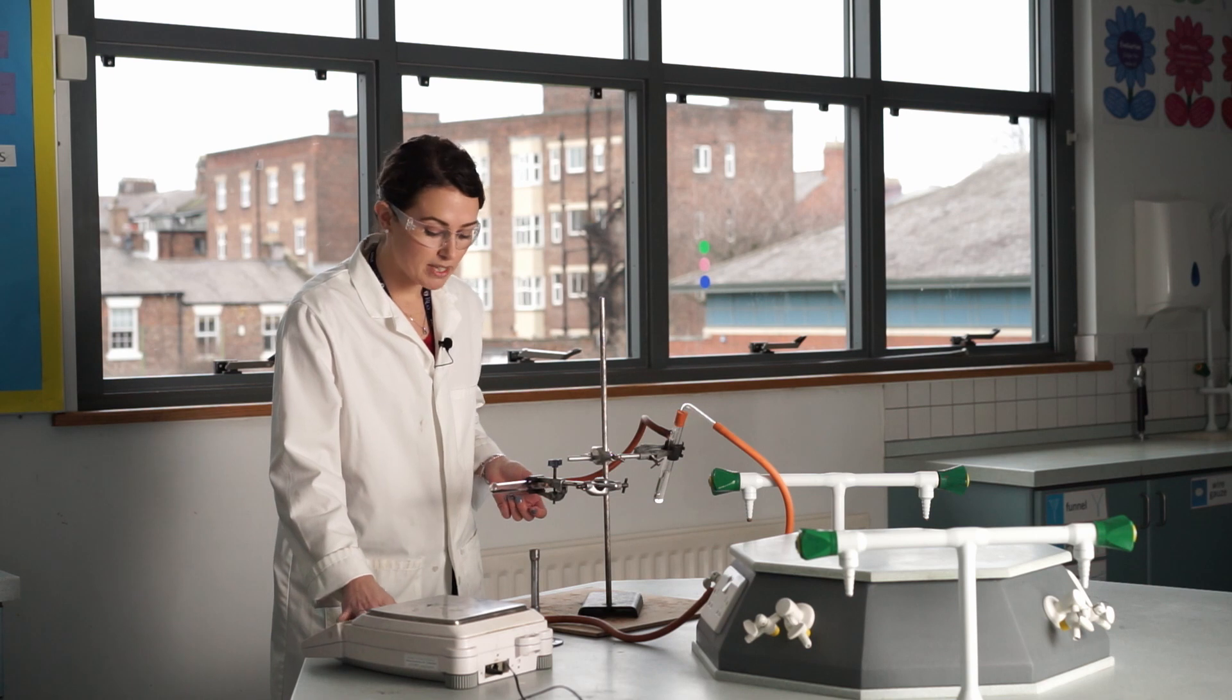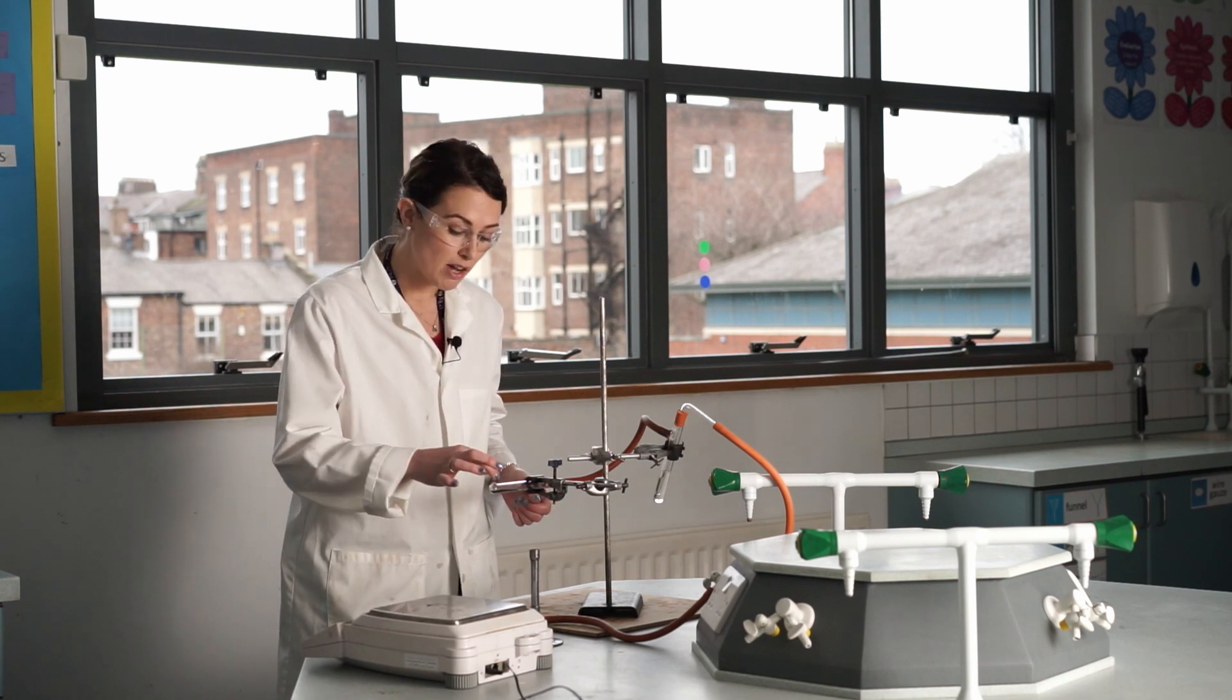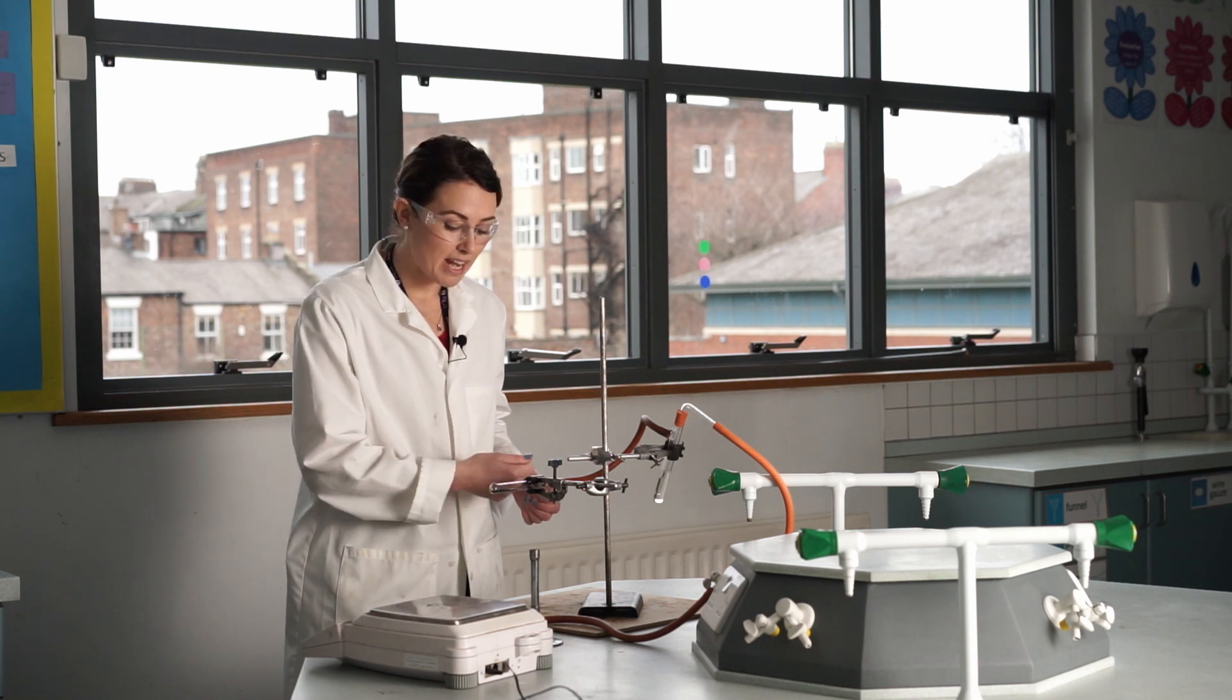All I want within this reduction tube is methane. After about 10 seconds, I'm going to take a match and I'm going to light the hole here in the reduction tube. And we should see a nice little flame. I'm going to let that run.